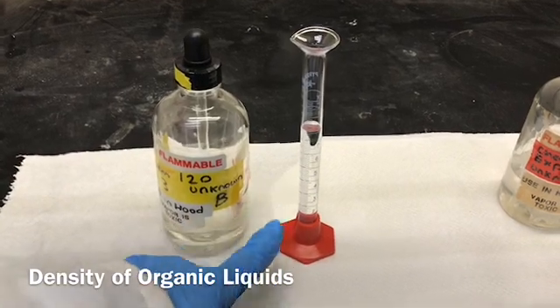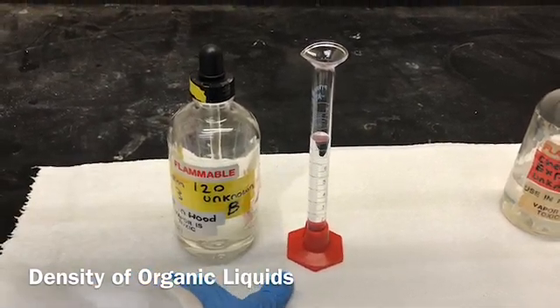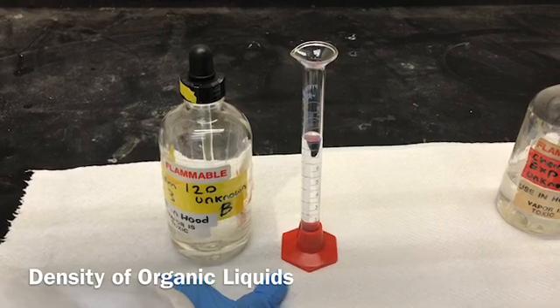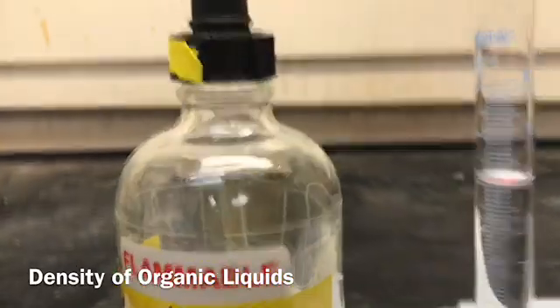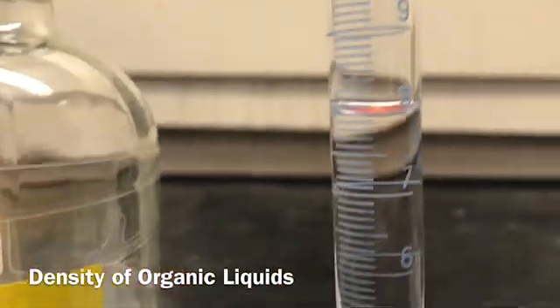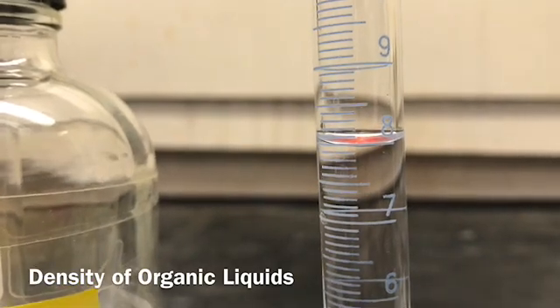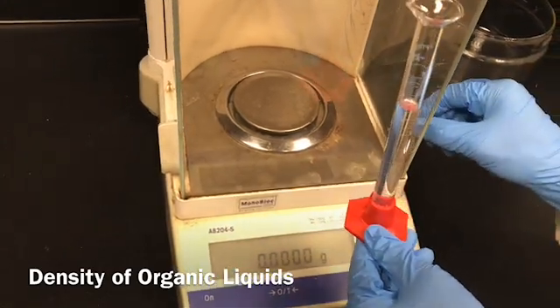So I've already added between 7 to 9 milliliters. Recording the mass of unknown liquid B in the graduated cylinder.